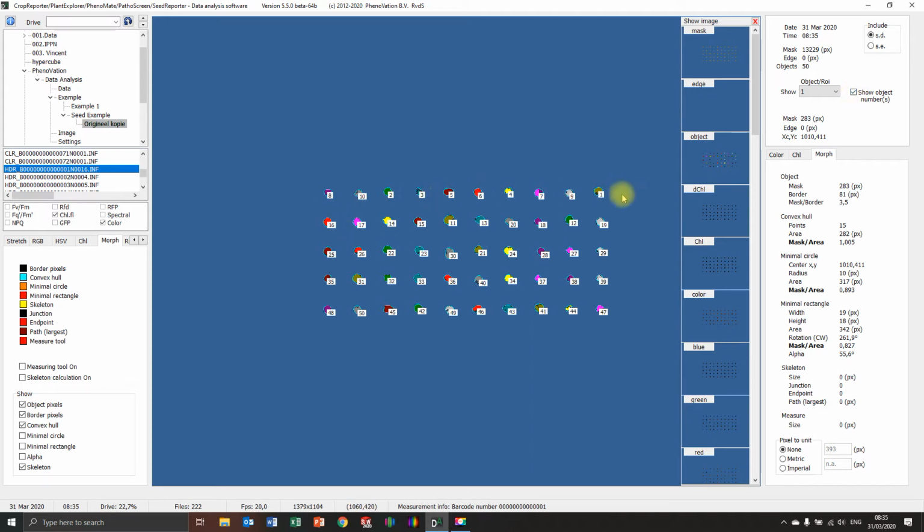You can see the numbers are not aligned. And that's because the computer is counting in a certain way. In this case, it looks from top to bottom, from right to left. It calculates. So this is the first pixel layer that's coming into the image. So that's one. But the second one from the top is this one. And the third one from the top is that one. Fourth, and so forth. So that's why 50 is over here, because that's the lowest amount of pixel rows, or the highest, the lowest, yeah, is with this one. So that's how it counts.